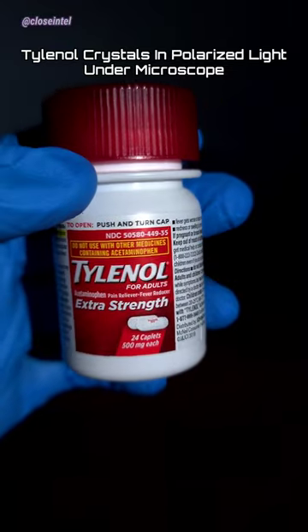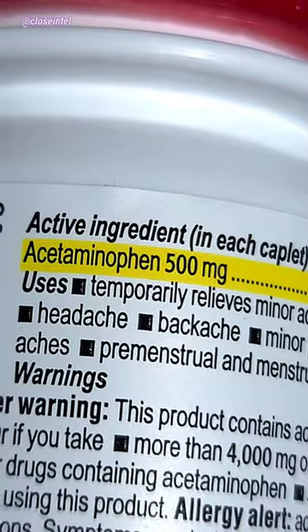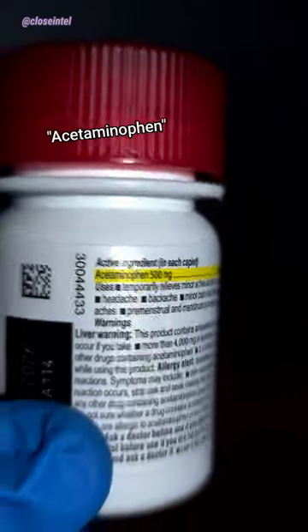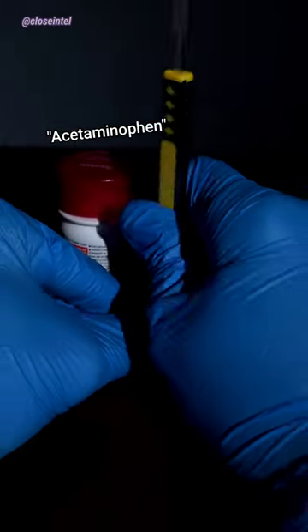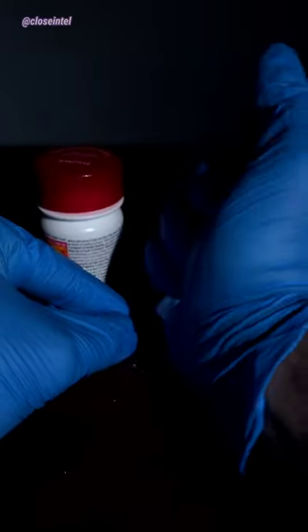Today I'm going to show you Tylenol under the microscope, but not just by itself because that would be boring. Tylenol's main ingredient is acetaminophen, which is an analgesic drug used all around the world.